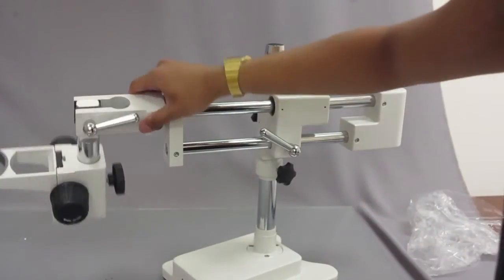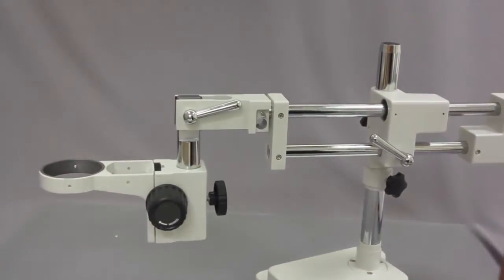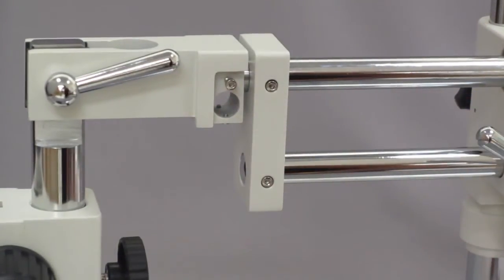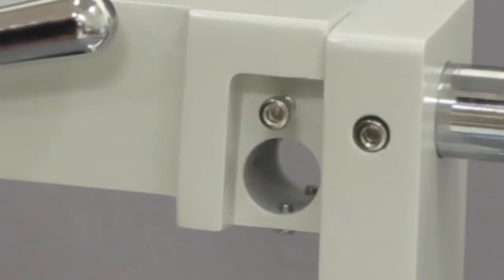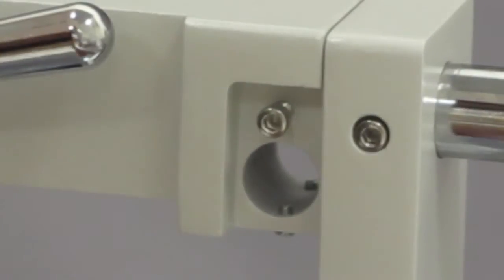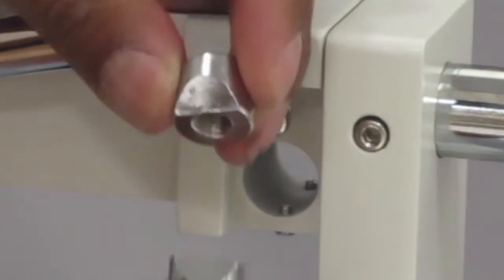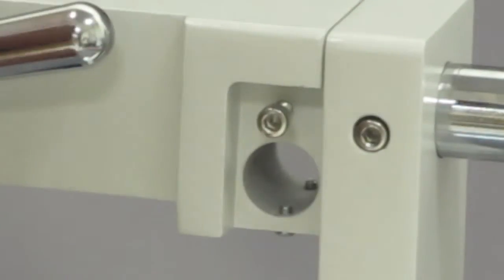Some of you might be saying it still wobbles — it still moves freely left and right. What you have to do is put one more piece in here to stop it from wobbling. If you look right here there are two screws at the bottom, one on the left and one on the right, and you're supposed to insert these two parts in there.